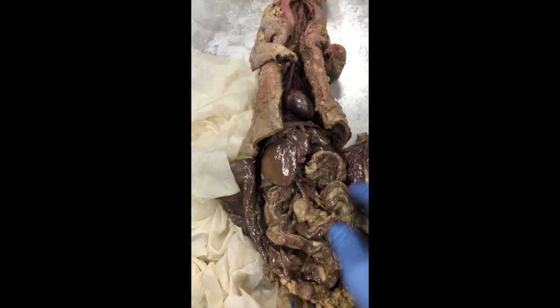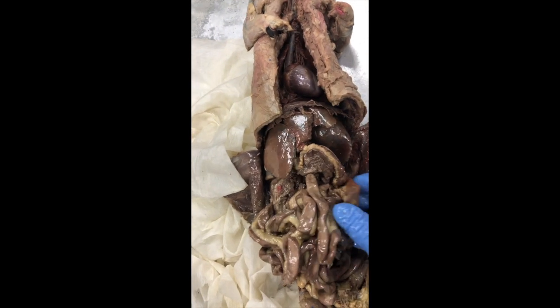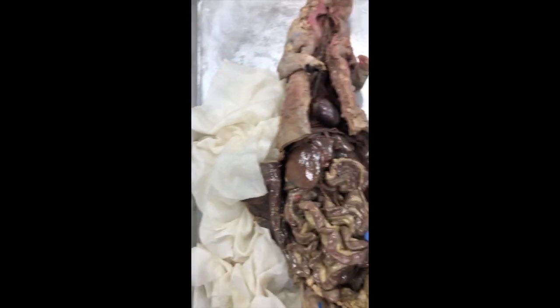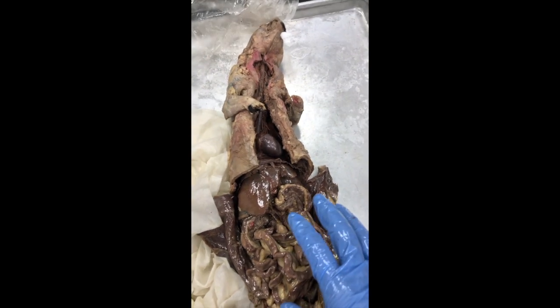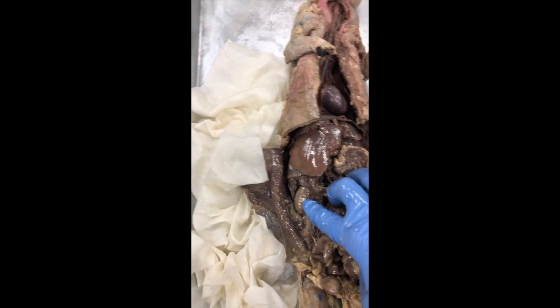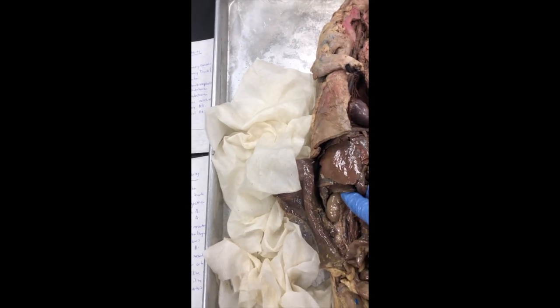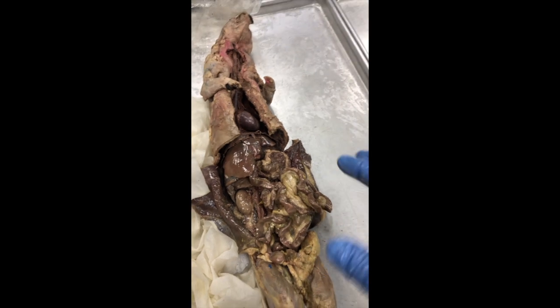As long as you can find the liver, as long as you can find that big empty sac, the stomach, the spleen, and then the mesentery is tough, but I think on test day we won't make it too difficult. We'll have nice separated veins, and as long as you also know what the other structures are, like you should be able to tell that that's a kidney, right? And the adrenals will be located just up and to the left. So if you can just find your landmarks, I think you should be good.